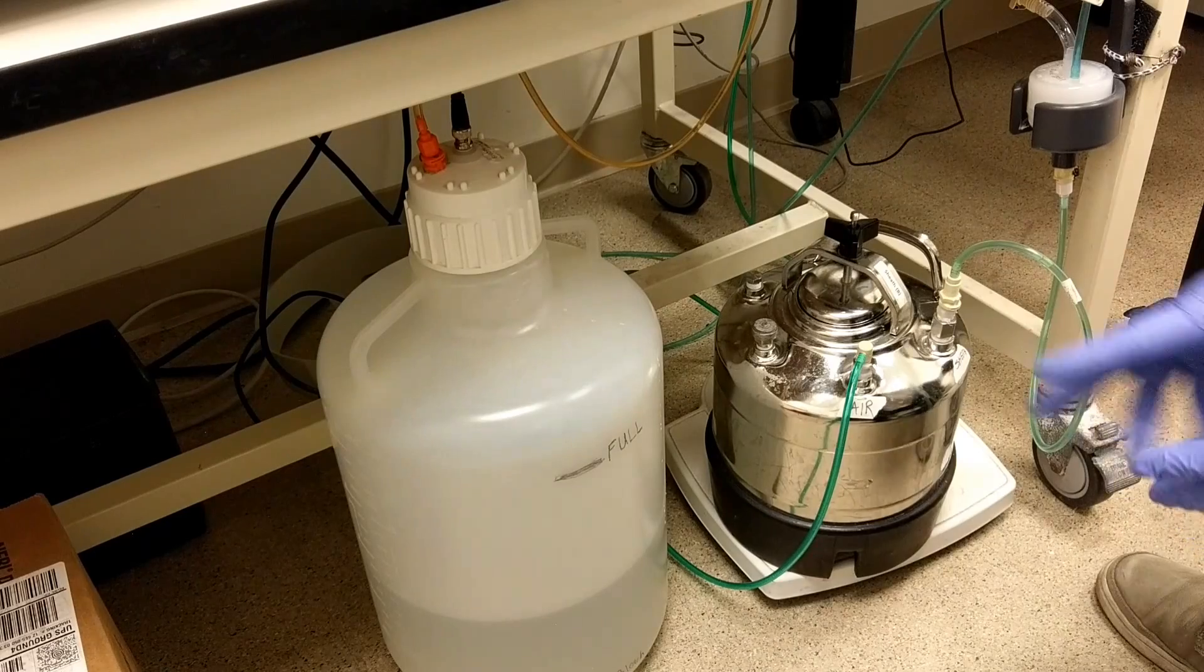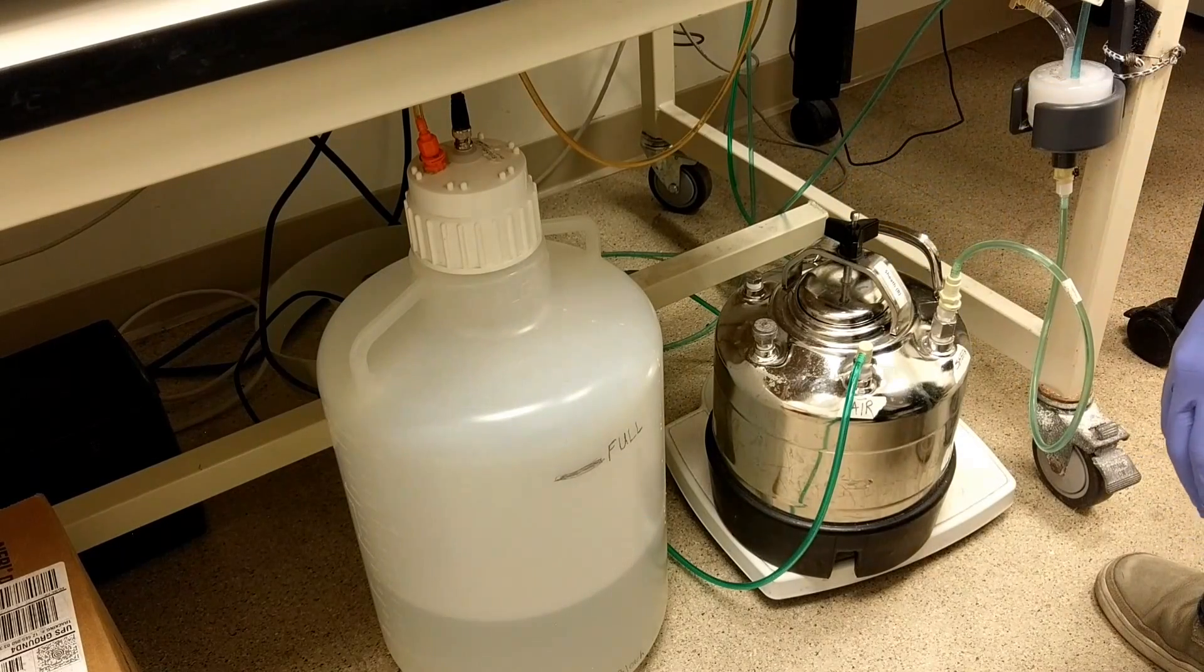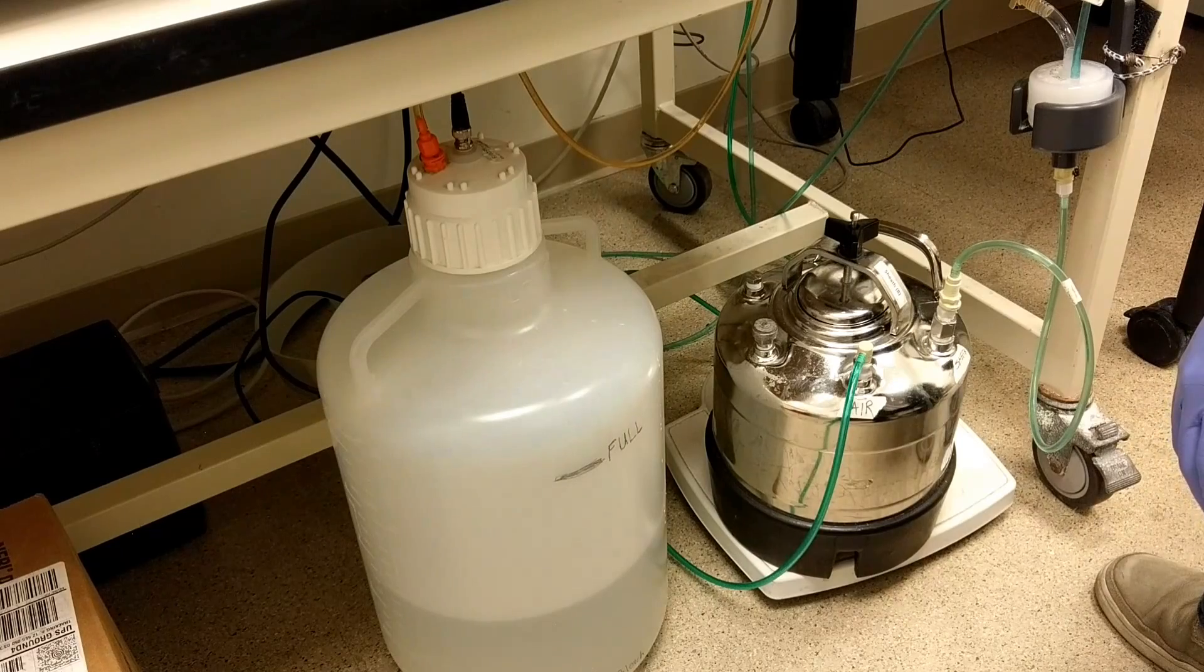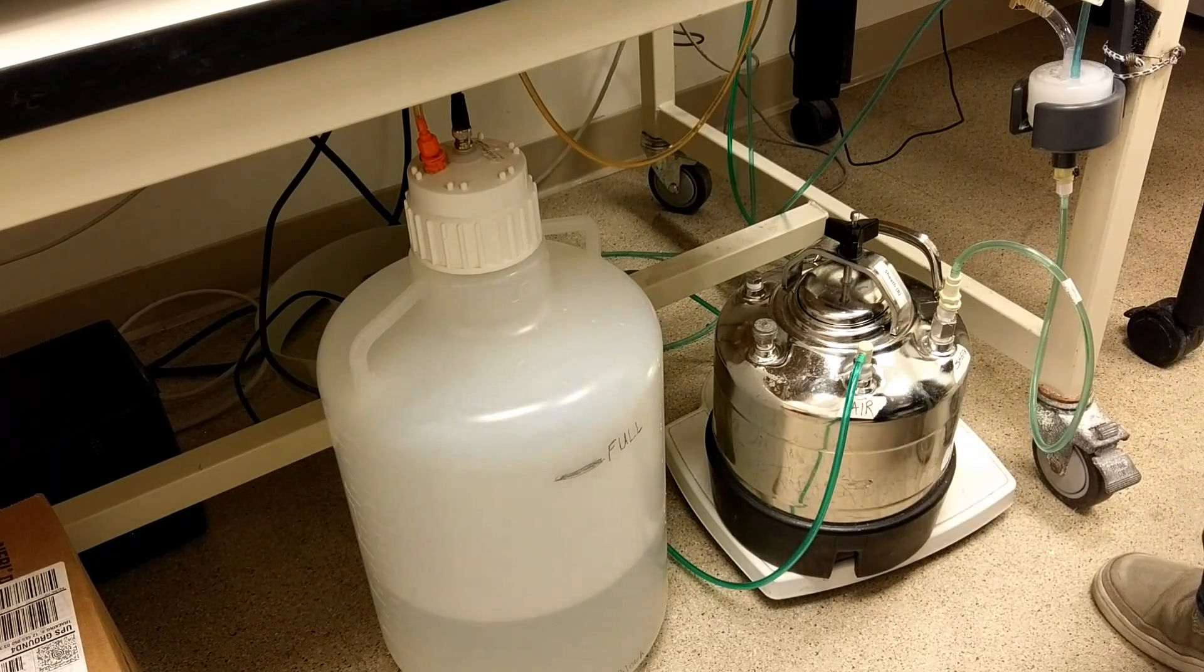The LSR2 sheath tank can run approximately four to five hours before it needs to be refilled. If there's a lot of night use or weekend use, you might find you need to fill the tank.